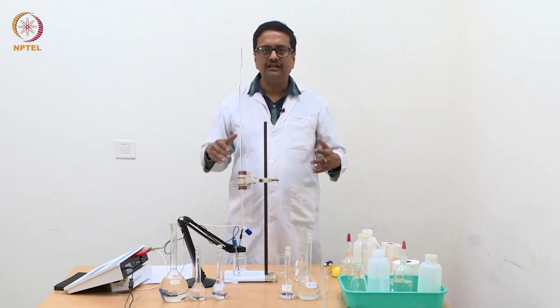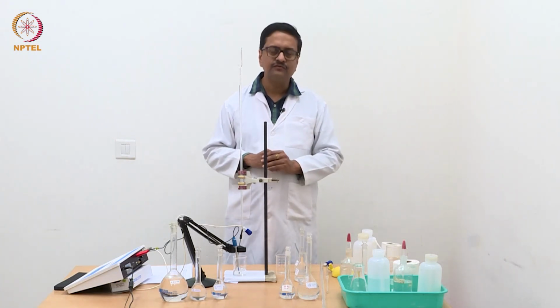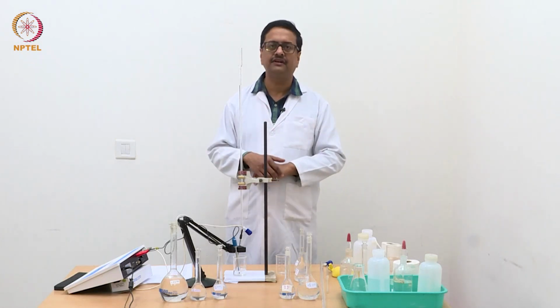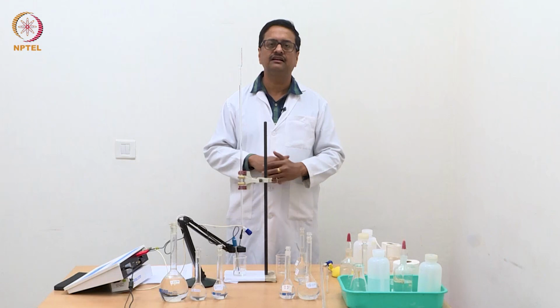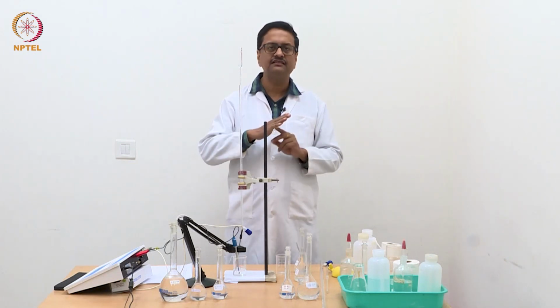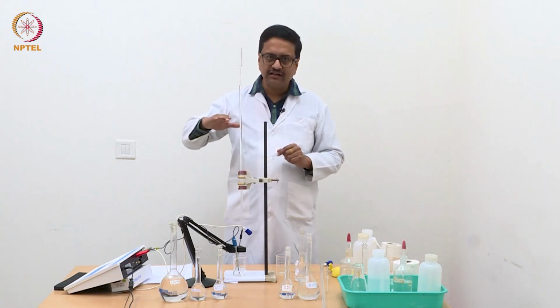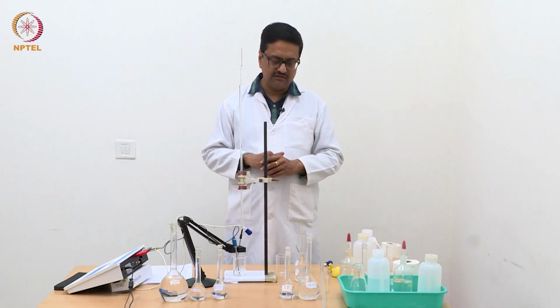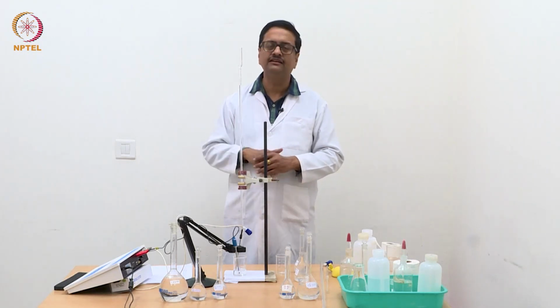And when the entire ammonium chloride is consumed, further addition of NaOH increases the conductance of the solution. So we will first see a steep decrease in conductance, then a shallow decrease, and then an increase in conductance with addition of NaOH.